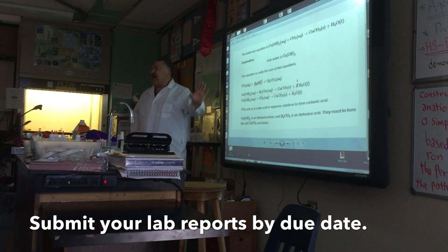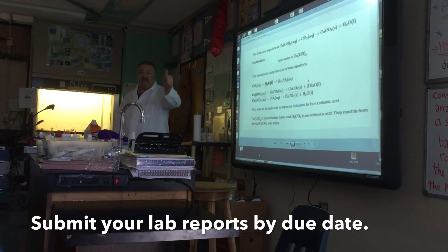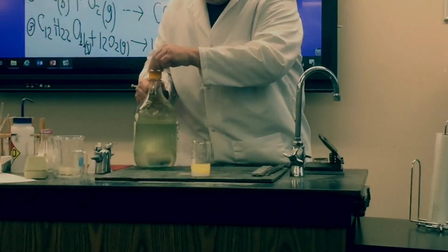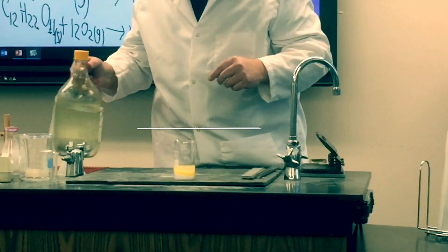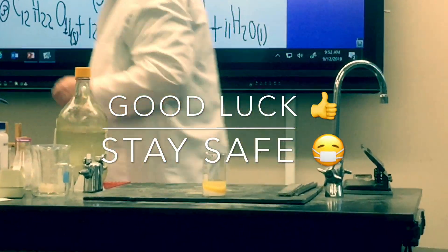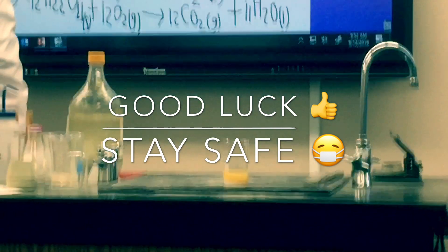You have five minutes — let's make it seven minutes — to copy that. Can you drink it? Keep an eye on the reaction.